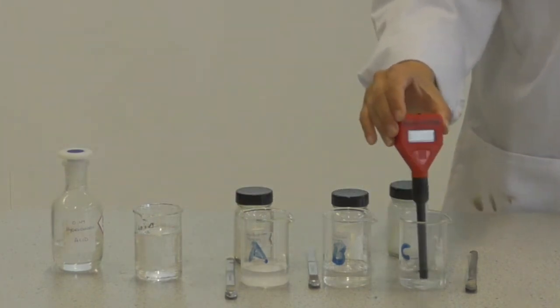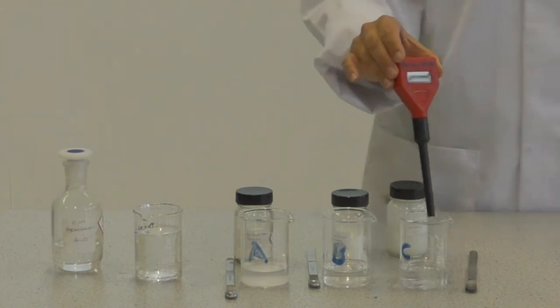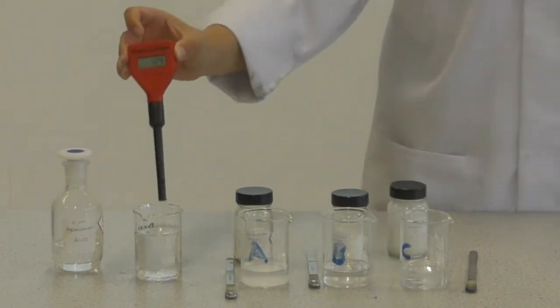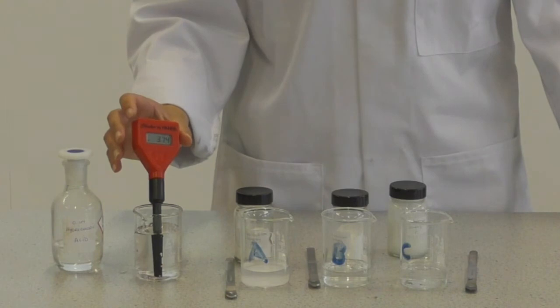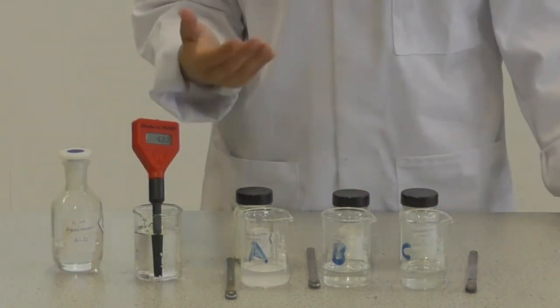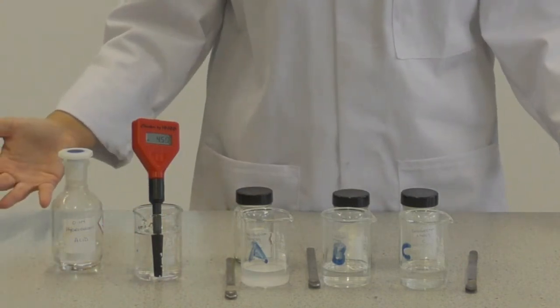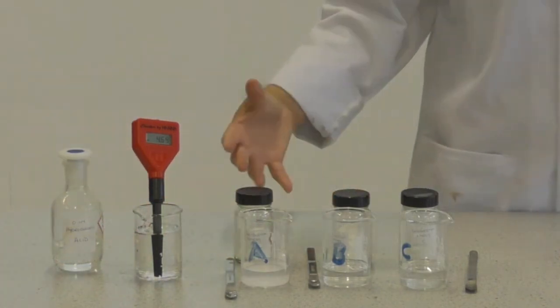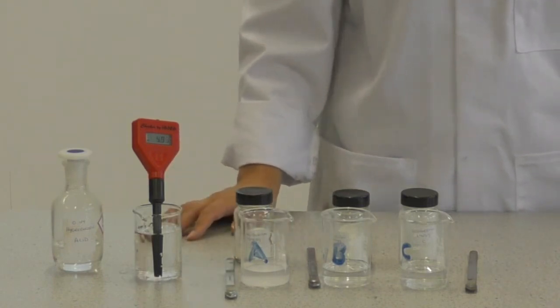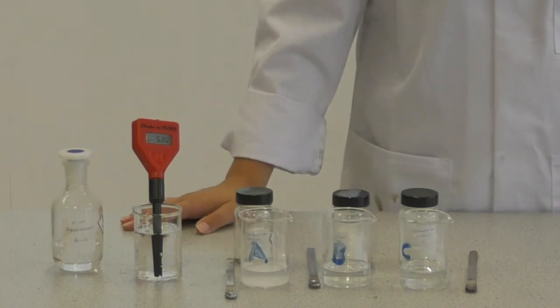That's all three indigestion remedies — A, B, and C — tested. We could improve the experiment by repeating it for more reliable results, finding an average, and measuring the exact mass of each indigestion remedy. We'll now look at analyzing the results.